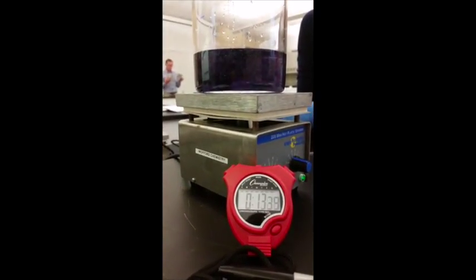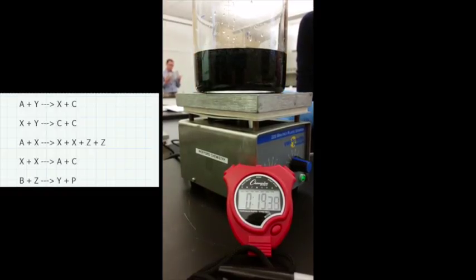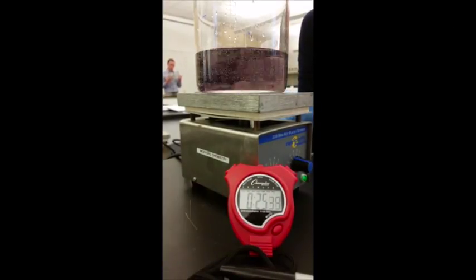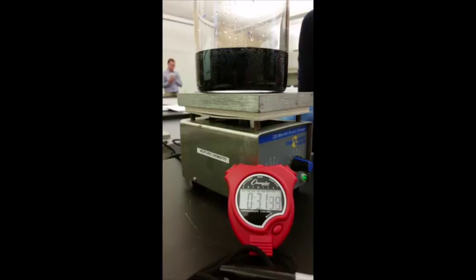The oregonator is the simplest realistic model of the chemical dynamics of oscillatory reactions. Through a complex reaction mechanism, the system oscillates between a brown iodine solution and a blue starch solution. Some of the compounds are starch solution, malonic acid, manganese sulfate monohydrate, hydrogen peroxide, sulfuric acid, and potassium iodate.